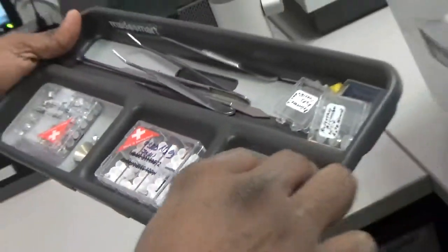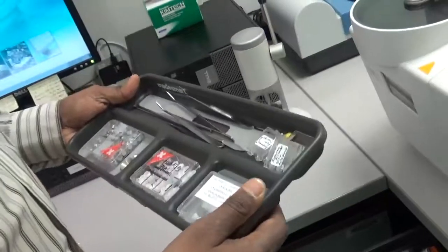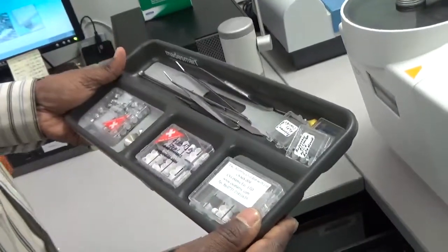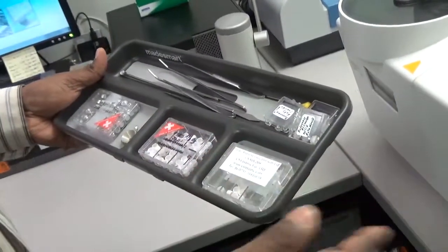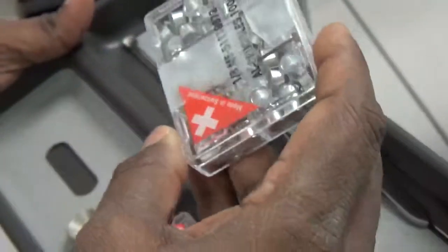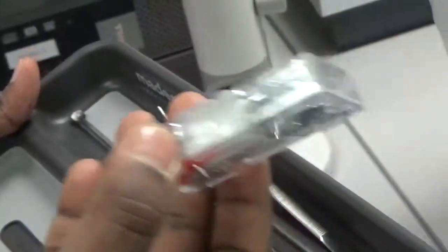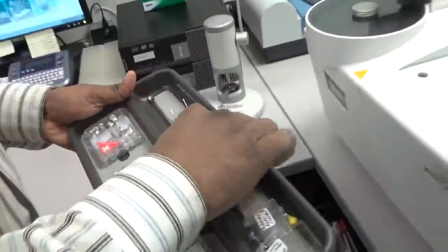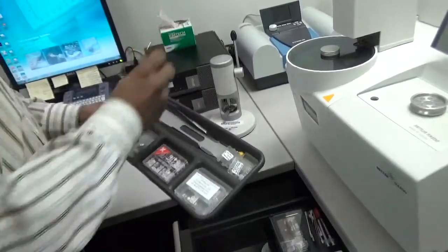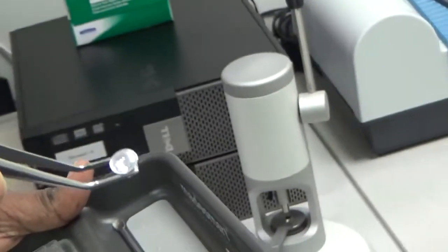Many times you can use the crucibles with a lid, but since we are letting the moisture and carbon dioxide evaporate, we don't put a lid — though you can also do it with or without a lid. These are the aluminum crucibles — the metal crucible as opposed to the ceramic crucible. This aluminum crucible also comes with a lid, and that lid is cold-sealed on the crucible by the sample press. This shows an aluminum crucible sealed with its lid.